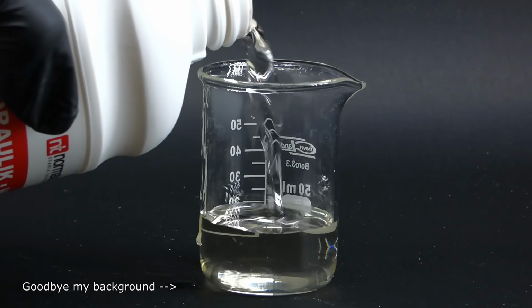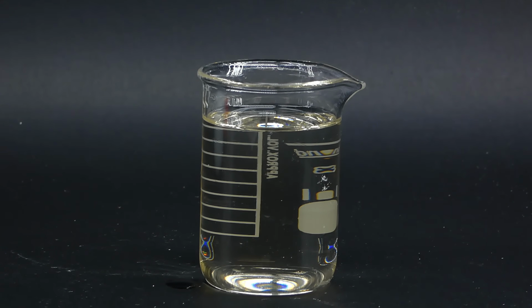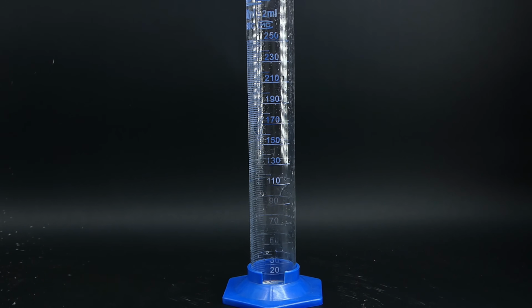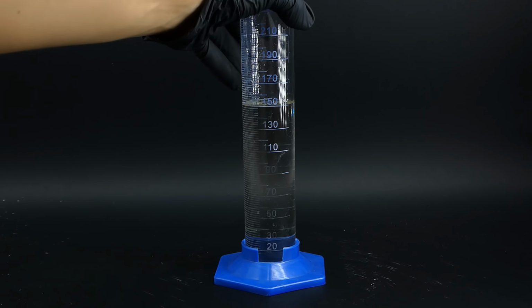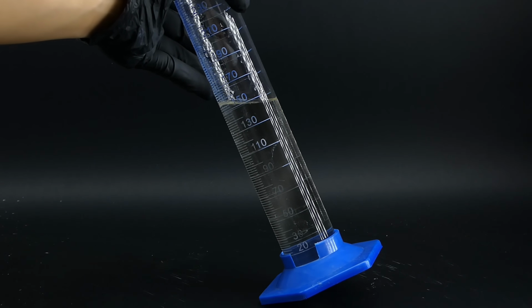Since it is composed of only 4% water, the acetic acid produced will still be glacial, and now that I know which acid to use, I ran some more math and calculated that I will need around 36 ml of it, but to ensure that all of the sodium acetate reacts, I went completely overboard and measured out 150 ml. I probably won't use everything, but sulfuric acid is very cheap where I live, so for me, this isn't too much of a waste.